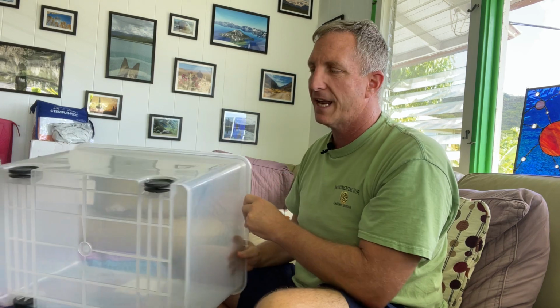What if we took something like this, and we'll go somewhere else in just a moment. But let's say we took this whole area, maybe the filter size is a little bit smaller than the base, and we put that in, and then we put, let's say, the lid for this on top, and that's where the fan was. What we now have, and let's say instead of going this way through it, it's now going this way, and we use the whole storage container as a plenum area. So instead of having that working area inside, which you could do the other way, we're still going to need a plenum area.